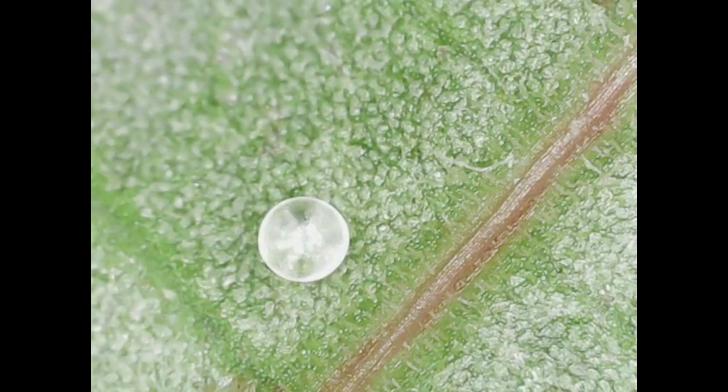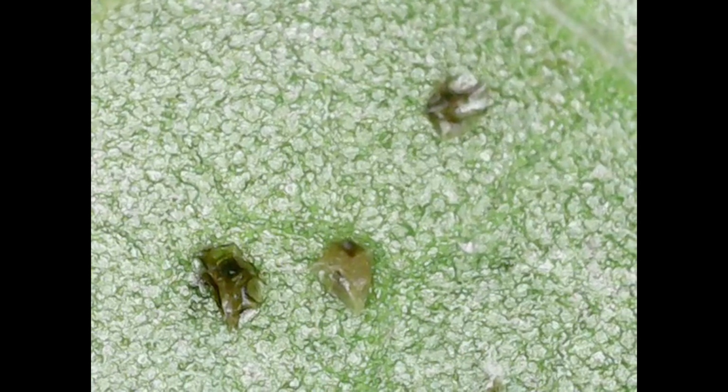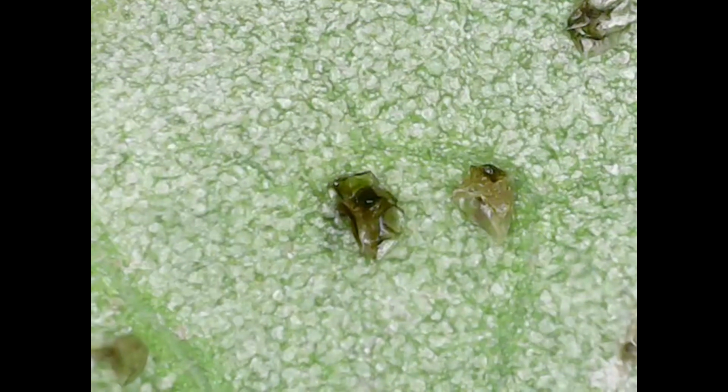And you should start seeing in a moment some more versions that look black and shriveled up. Those are the black, oxidized Extrafloral Nectaries as well. So that's where you get the two colors, which I thought was kind of cool. And you can see some of the blister variegation coming through on the bottom part of the leaf as well. You can see those divots there as well. But yeah, some Extrafloral Nectaries.